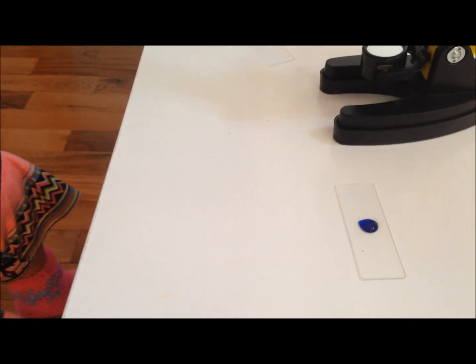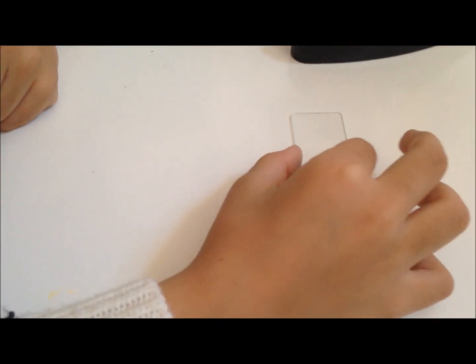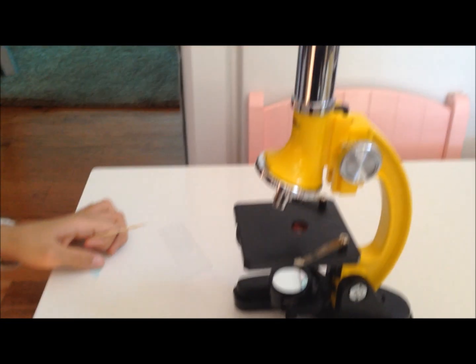I need to find it to drop it somewhere. There it is. 45 degrees angle — drop it. There you go. Now for the excess one, you need a paper towel or a tissue. Just wipe it and get your microscope ready now.